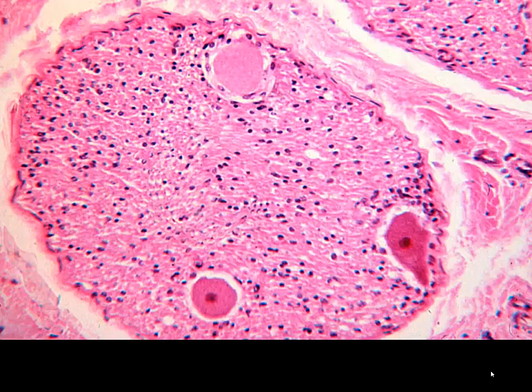Now, in this particular image, we can see several nerve cell bodies. These are likely going to be either our sympathetic or parasympathetic autonomic nervous system ganglia. So we might imagine these being in one of our collateral ganglia, or they're going to be present in our dorsal root ganglia. You can see the characteristic nucleus, dark nucleolus, looks like an eyeball. And then many of the other cell nuclei that we see, much smaller, are going to be neuroglia. And since we're in the peripheral nervous system, by and large, those are going to be Schwann cell nuclei.